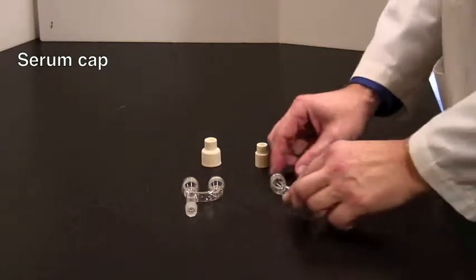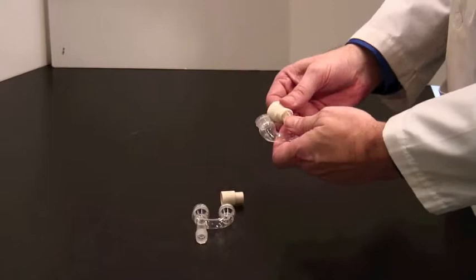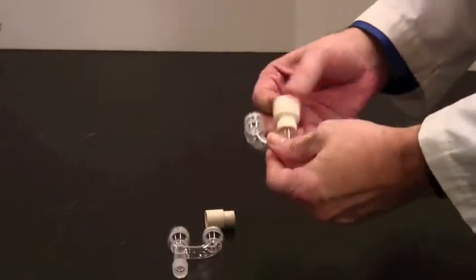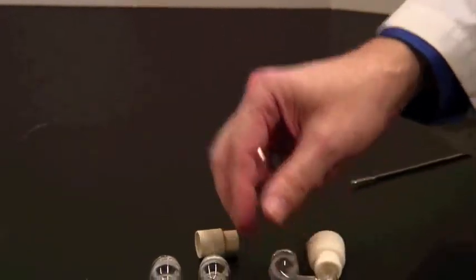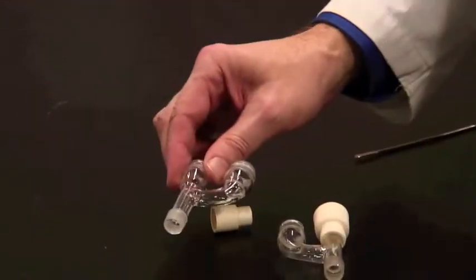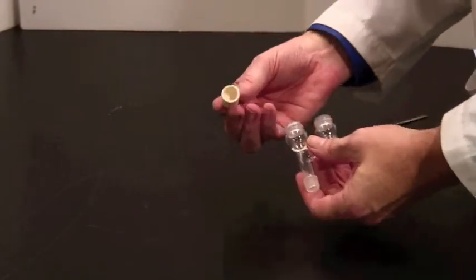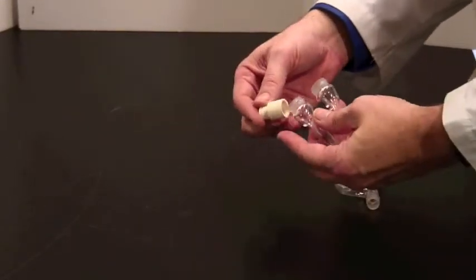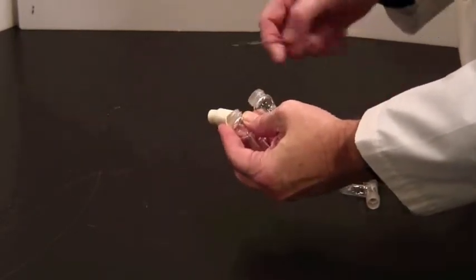You'll be covering the end of those with a serum cap. If you have one of these, take a large serum cap, and it fits over like that. The serum cap is where you'll be putting a needle shortly. If you've got two wide ones, you'll need to use a narrow one. You'll notice I've taken my gloves off for this because it's a bit of a struggle.